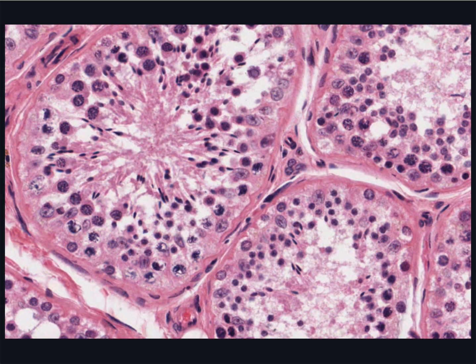The cytoplasm becomes very eosinophilic during meiotic division, and the chromosomes cluster into a dense, irregular clump. They may be in either the first or the second division of meiosis. The metaphase plate looks like a black irregular blob within the cell. Here's one over here.